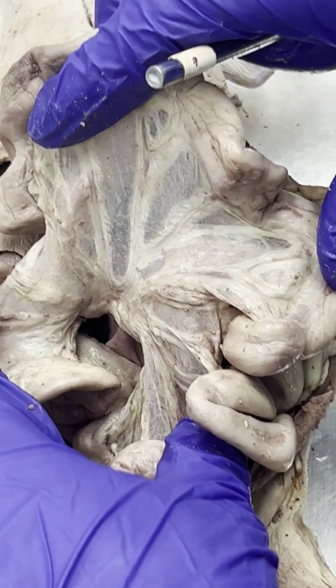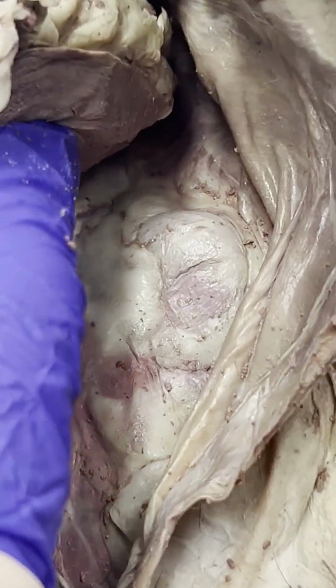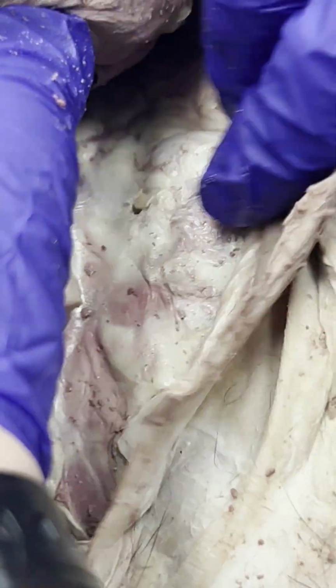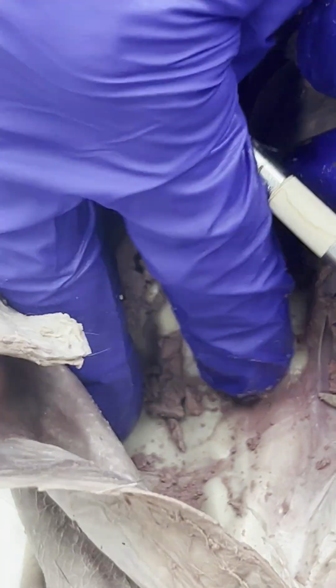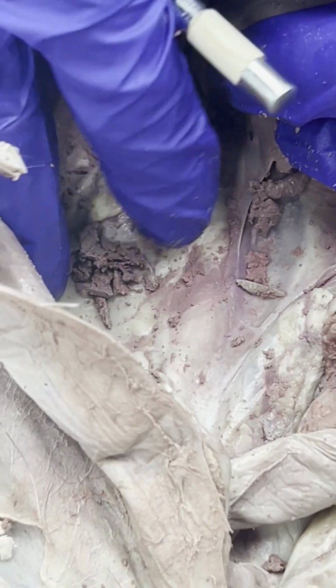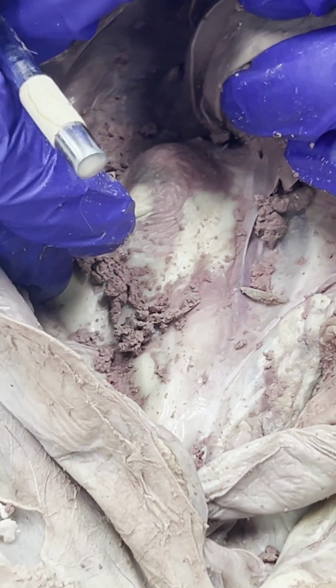Okay? And I think the last structure that we need to go over are the kidneys. We'll learn more about the kidneys in the urogenital system, but here is one kidney of the cat that's surrounded by a lot of this fat right here. But here's one kidney, and then we'll hop on over to the other side to show you the other kidney. Lifting up the liver, which is right here. And then in the urogenital system, we'll actually cut one of the kidneys out of your cat, and do a cross-section of it to see the internal structures of that kidney.